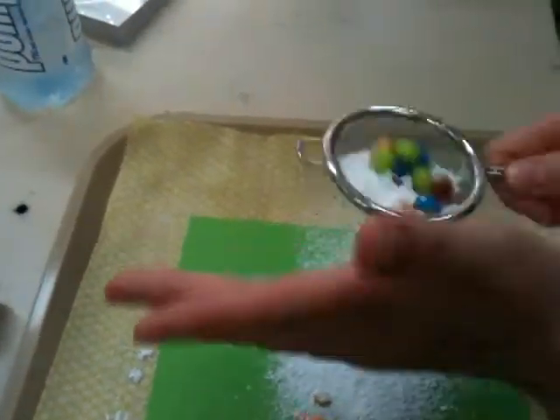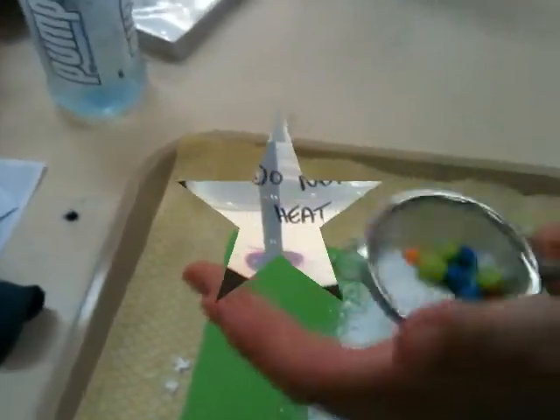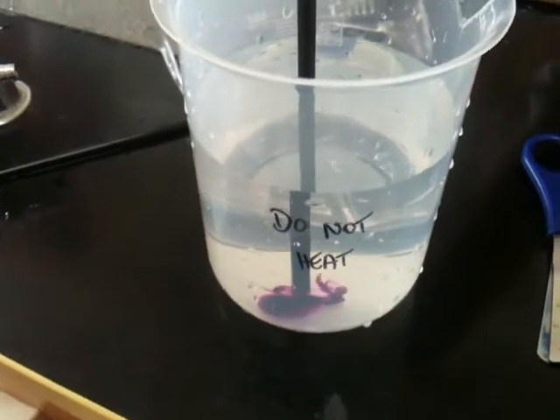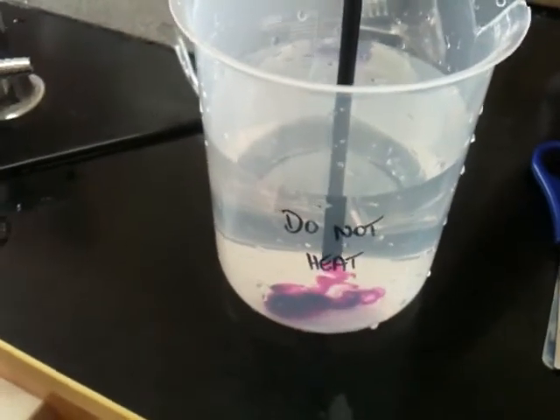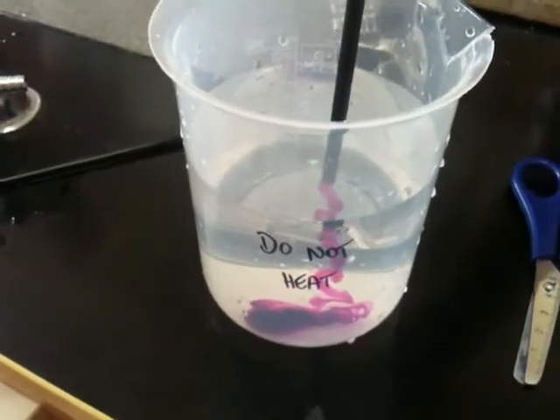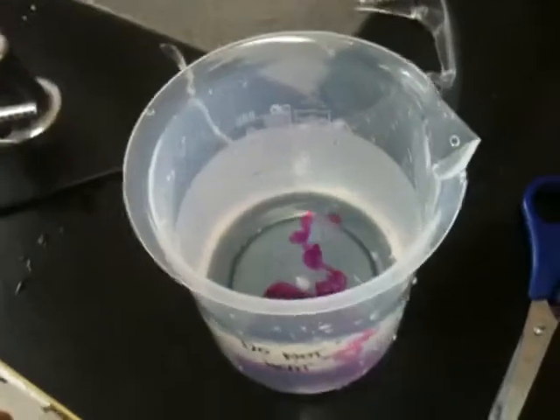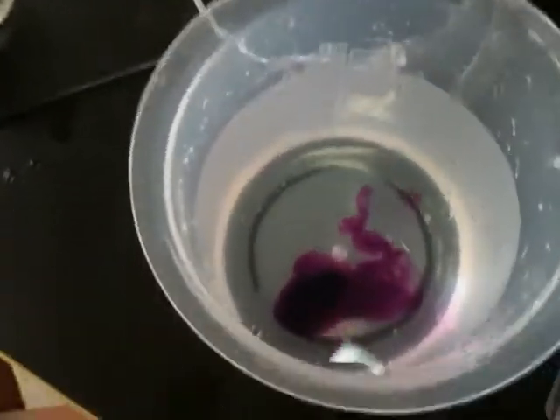Yeah, lift it up. Do I take my finger off the top? Yeah, and lift the whole straw out. So what are we demonstrating? Diffusion. Fantastic. How cool's that? We win on the cool stuff. That looks trippy.